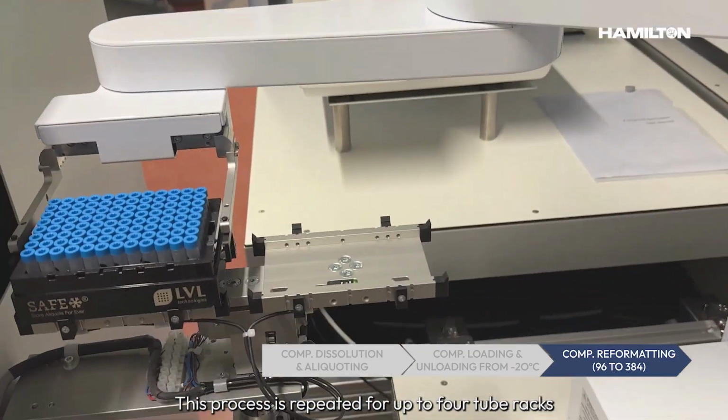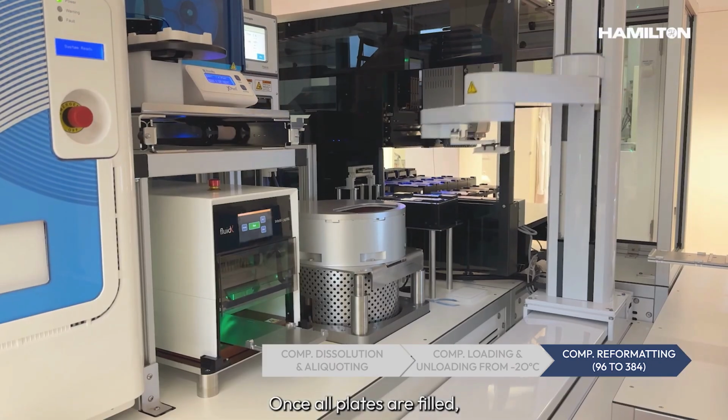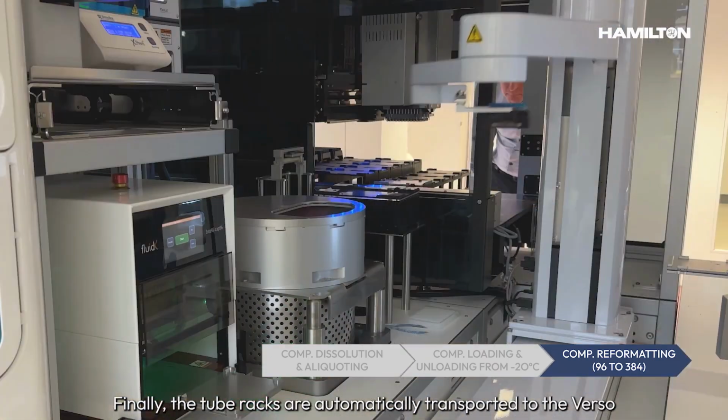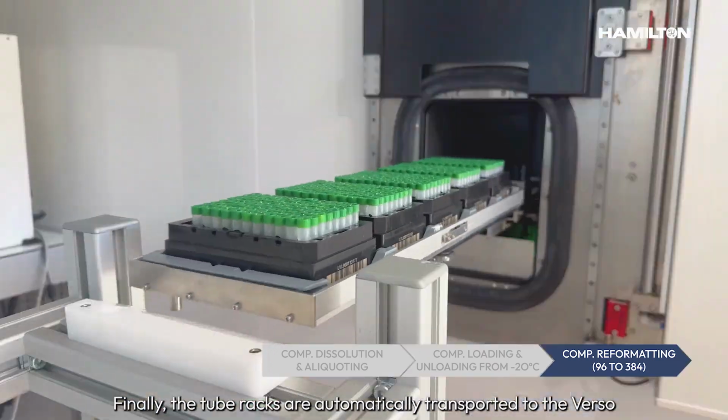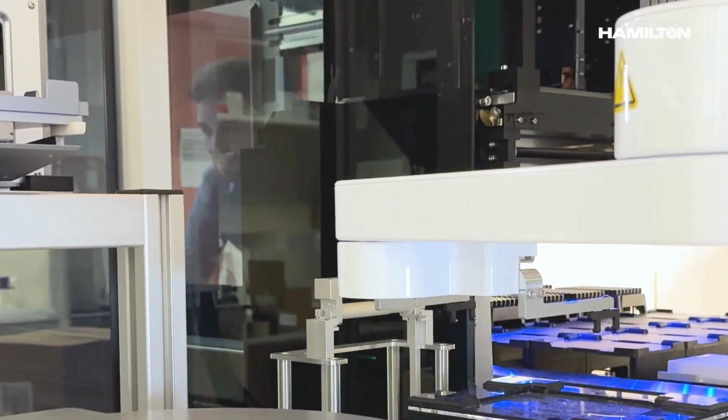This process is repeated for up to 4 racks to fill the 384 well target plates. Once all plates are filled, they are sealed and returned to the plate hotel. Finally, the tube racks are automatically transported to the Verso, and all the information is updated in the Verso database.